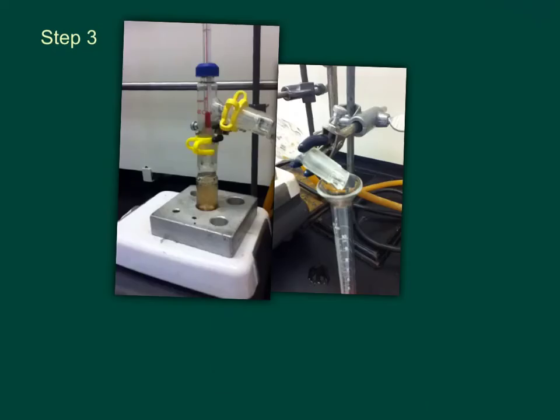Now we're going to heat the content to a gentle boil below 96 degrees Celsius. Now we're going to see a video where we have our condensation occurring. We're going to be seeing how the vapors condensing will move down the water-jacketed condenser and condense into our product in the receiver.